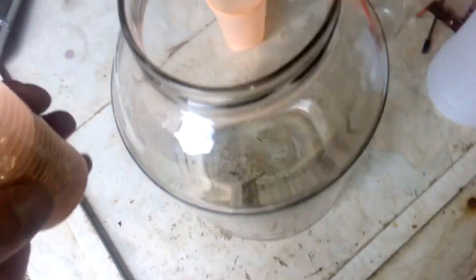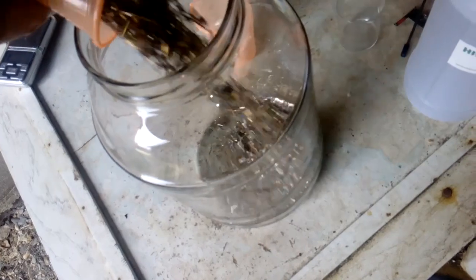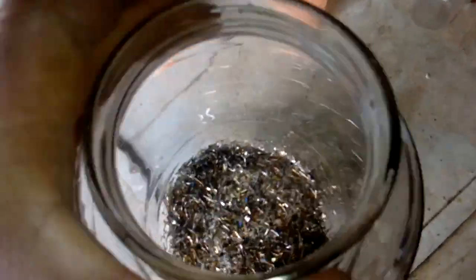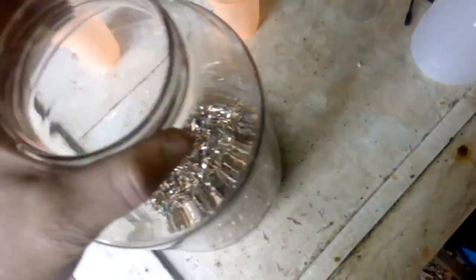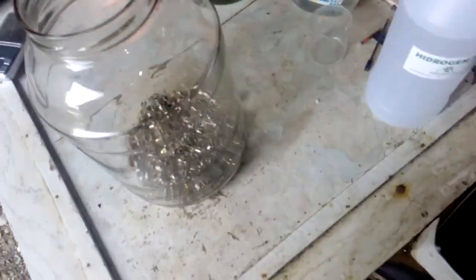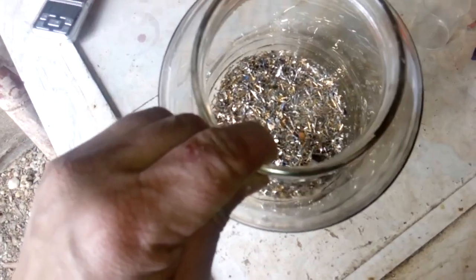We will take a big jar and put all that inside. I use the big jar because the surface — when I shake like this, you see how the pins spread around — and the acid will attack more surface. I can use copper chloride but I will not use it this time.